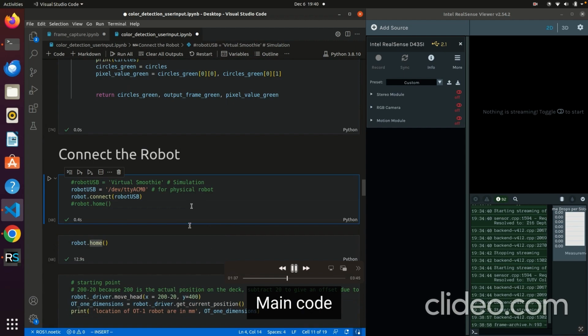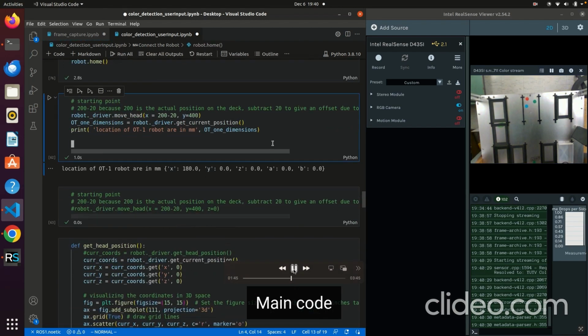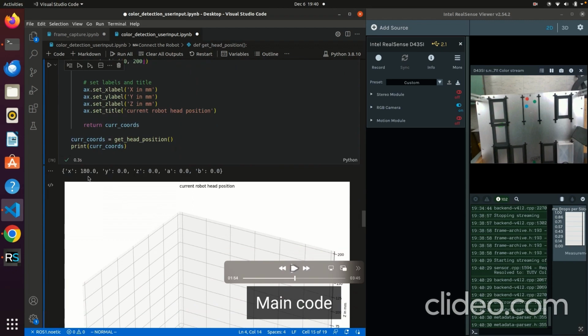Then you connect the robot using the Opentrons API, and here you can see connect your robot, and you home the robot to reset it. Again, you reset the system at the starting point, and here you could see this is like a simulation to show currently the robot is homed.